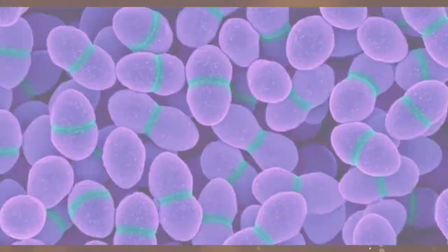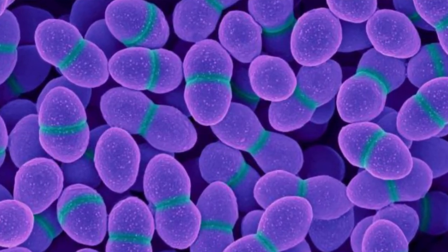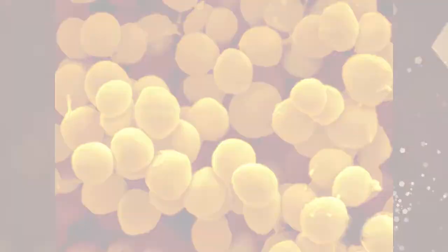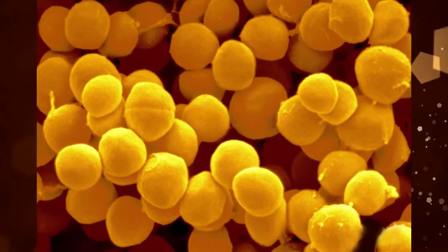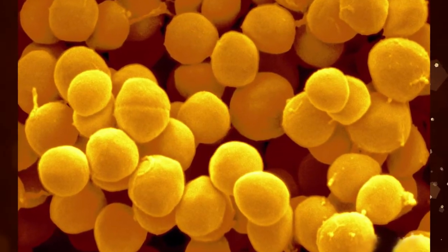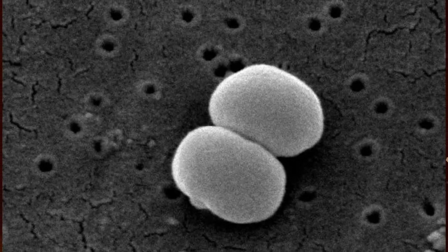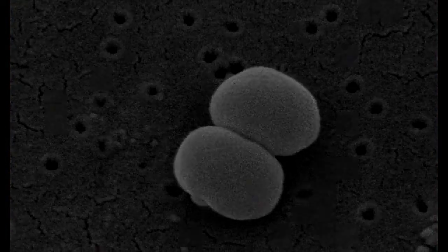Usually Enterococcus faecalis, Escherichia coli, Staphylococcus saprophyticus, and Staphylococcus epidermidis display gamma hemolysis.